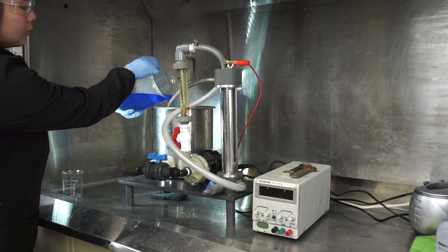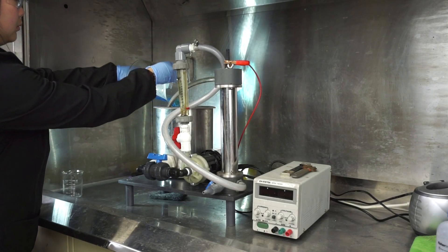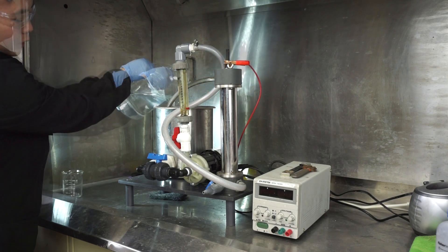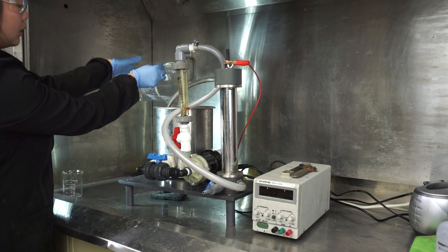This particular test is to demonstrate the recovery of copper cathode from our copper sulfate feed solution. We can test a range of feed materials to recover not only copper, but also silver, nickel, tin and others.